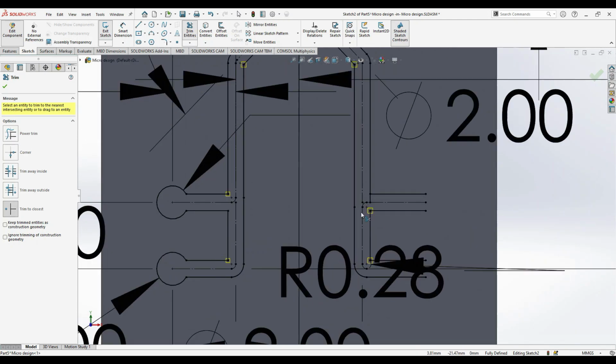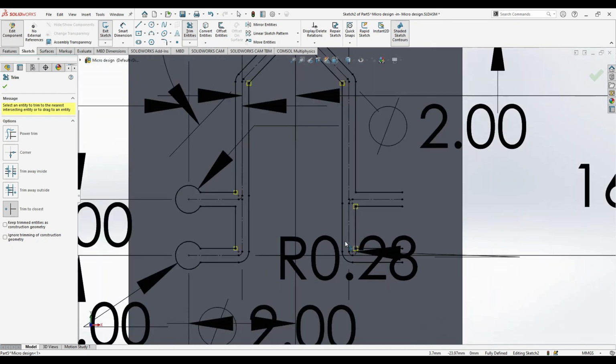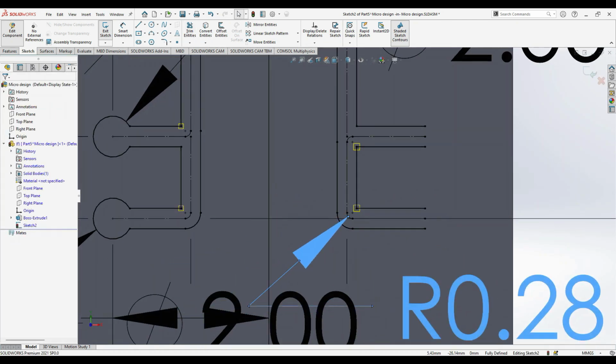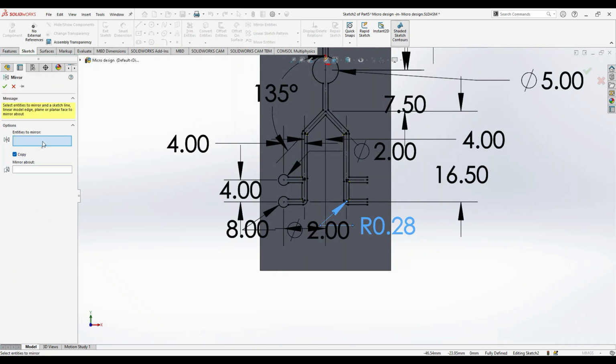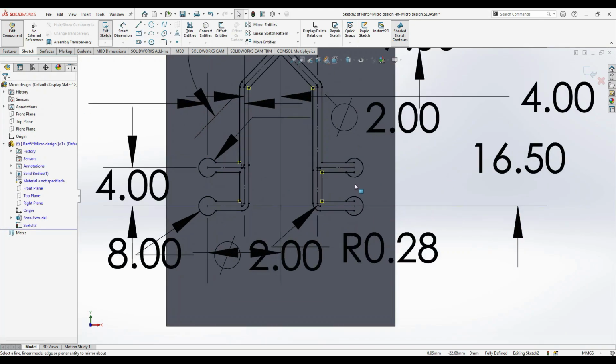Okay, now nothing to worry. Oh, this one is missing here. Okay, we close everything, and then just create a mirror entity. The entities to mirror is this circle, and take a mirror about the center line.